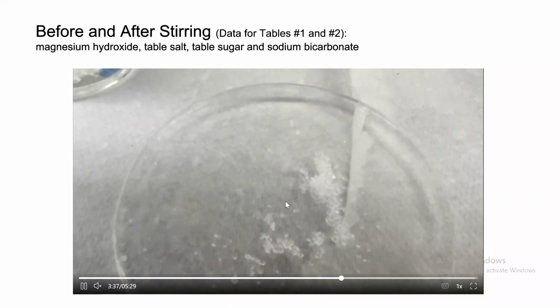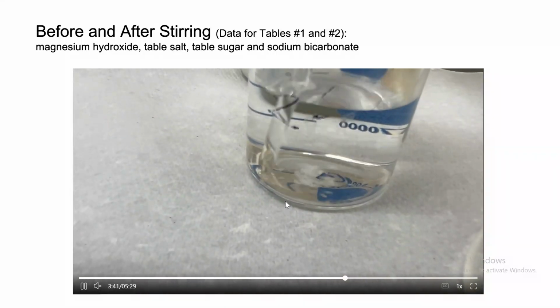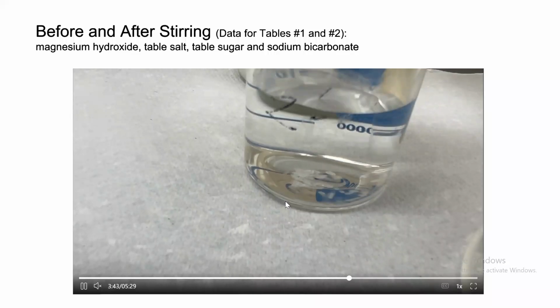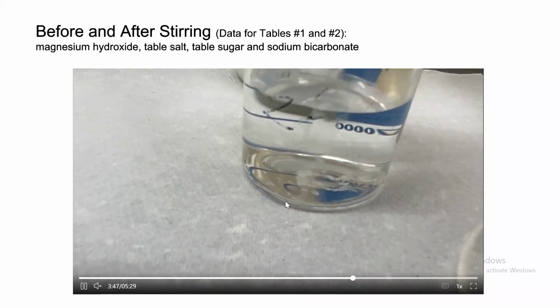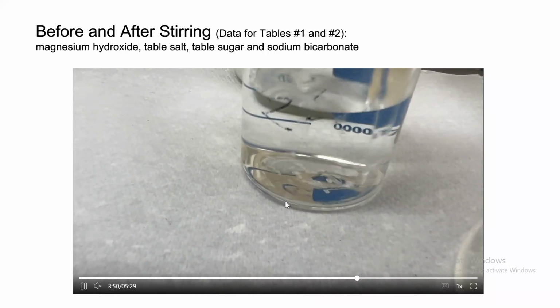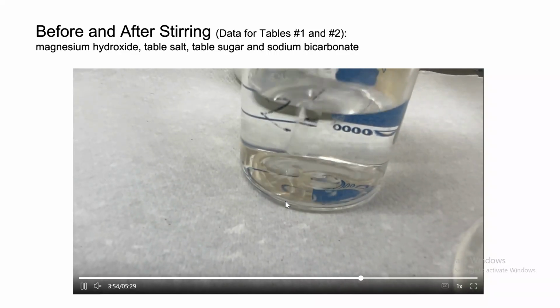Most of the sugar that we added dissolved, but you can see a little bit of crystals at the bottom. And why is that? Because every amount of water can hold only a maximum amount of solute, and that's temperature dependent.